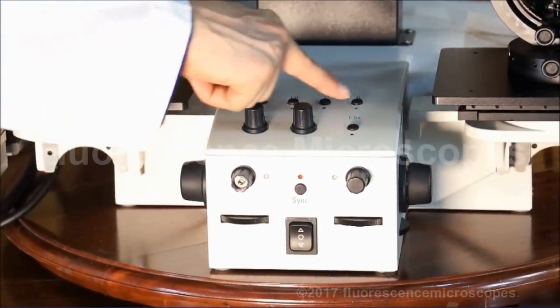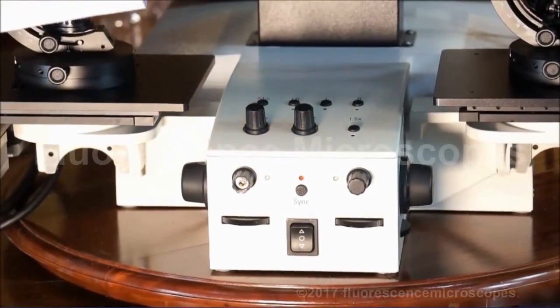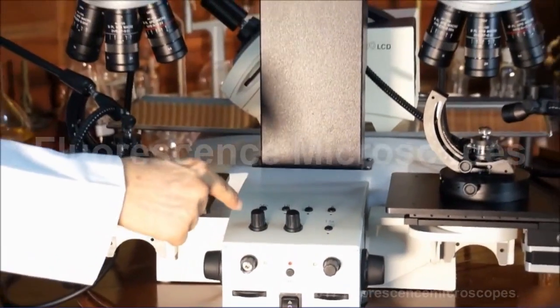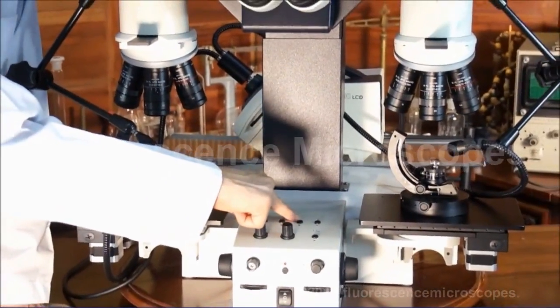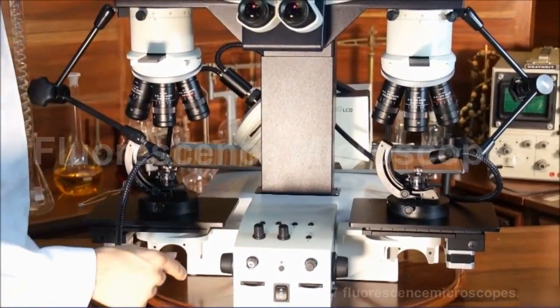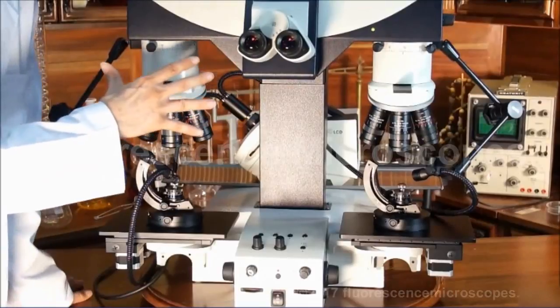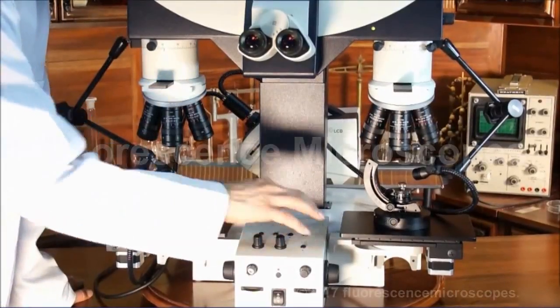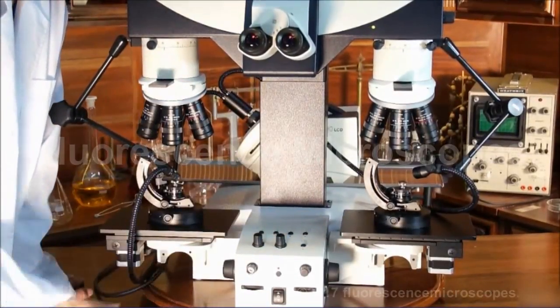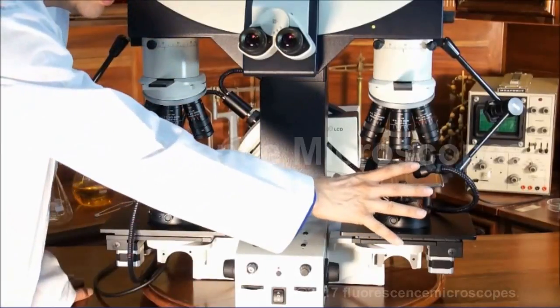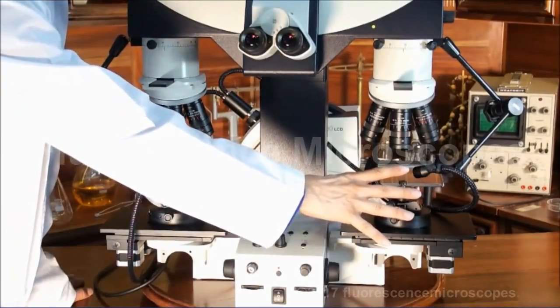These buttons are for your image. You can hit L, and it takes everything on the left side. It's 100% in your field of view. You can quickly hit one button, and then the right side is 100% in your field of view.